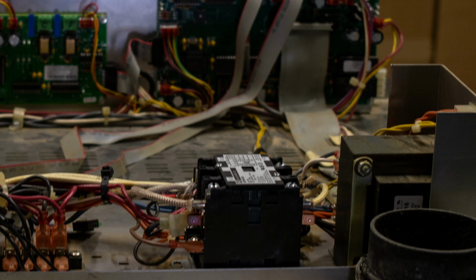If that wasn't enticing enough, I personally handle each unit before it ships out our door. That's right. Each refurbished NCAT that we sell gets touched by me. He means inspected. Every unit gets inspected by him.